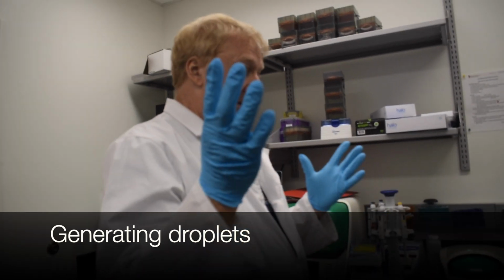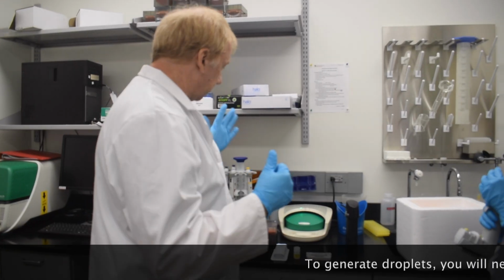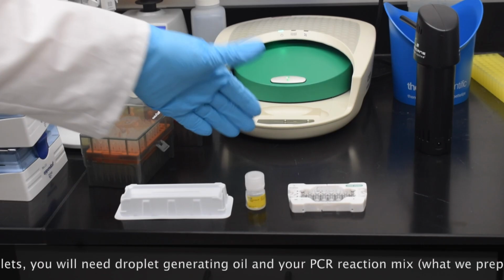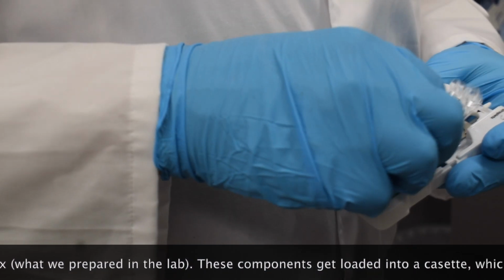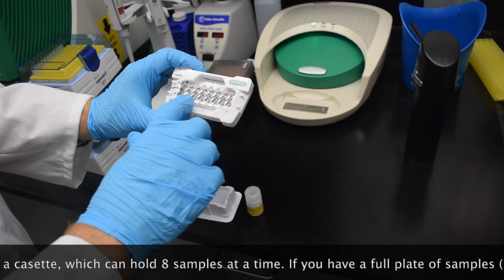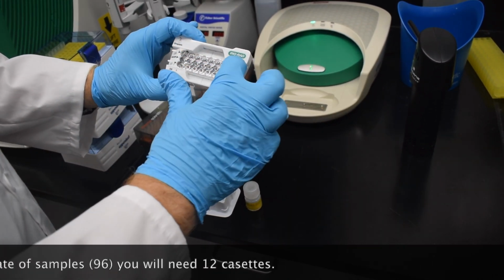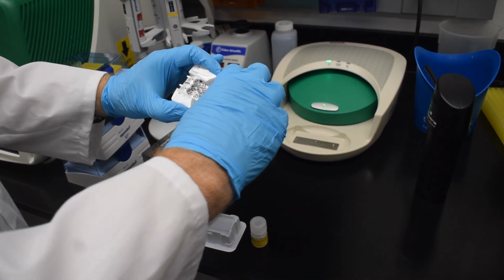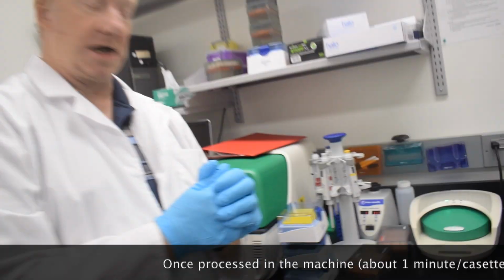Okay, so we are here with our PCR reactions set up, and we are going to start to make droplets. So this is the droplet generator. This is the droplet generating oil. This is a boat to put the oil in, and then we have a holder with a cassette cartridge clipped together, and then 70 microliters of oil will go in the lower chamber. Our 20 microliters of our PCR reactions will go in the center chambers, and then when it comes out of the machine, this upper row will have the droplets, with each droplet containing a PCR reaction.